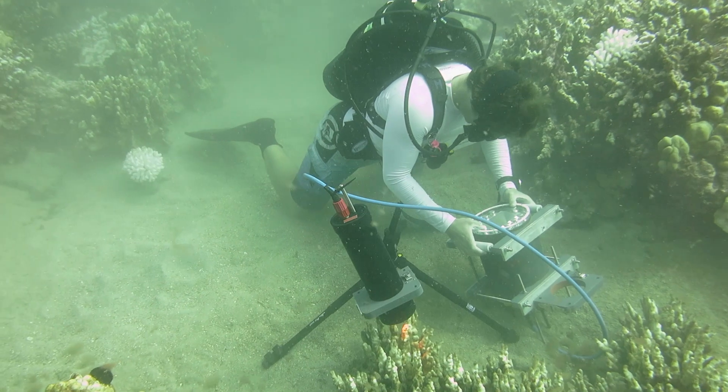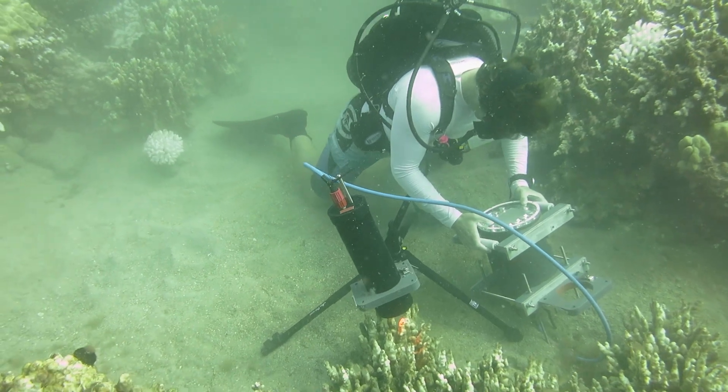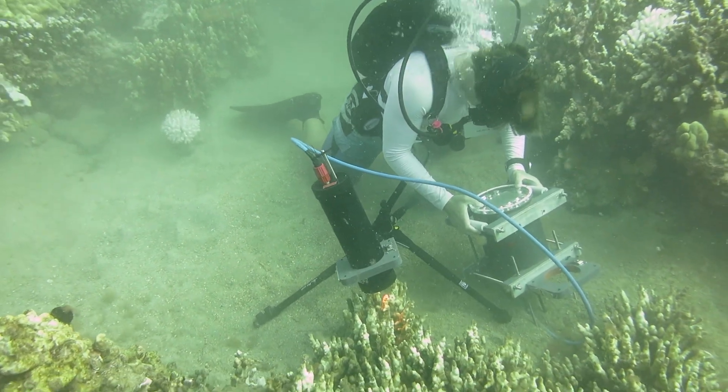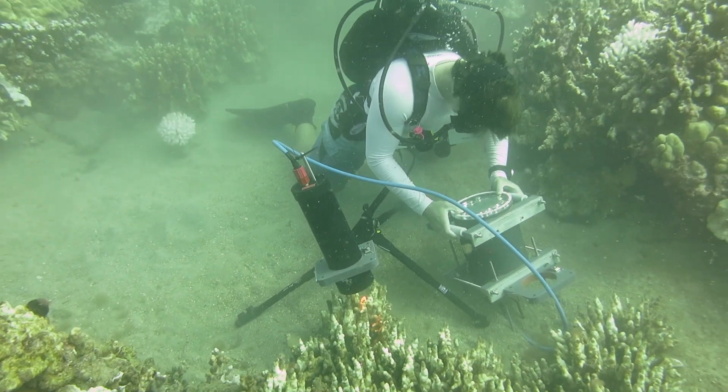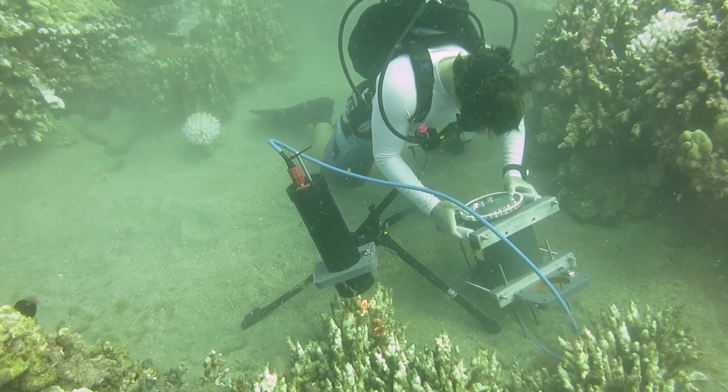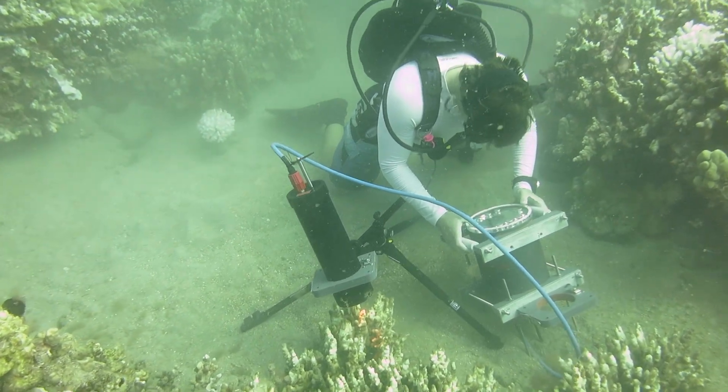The ocean is a really complex and dynamic environment and ideally we want to study organisms in their natural setting, so we built this system to take microscopic images underwater.